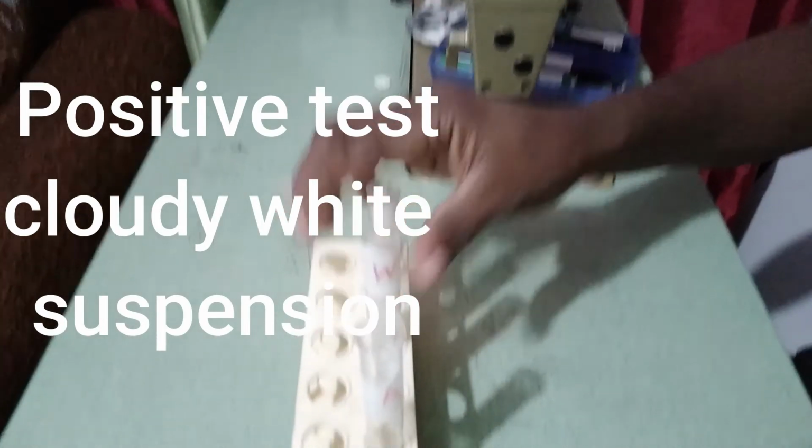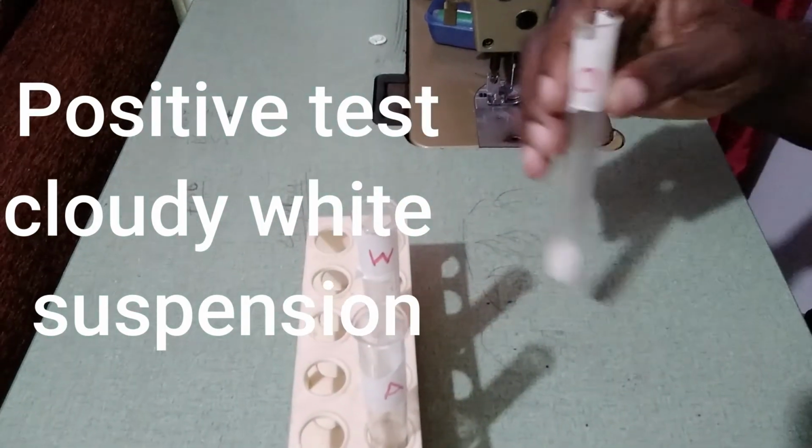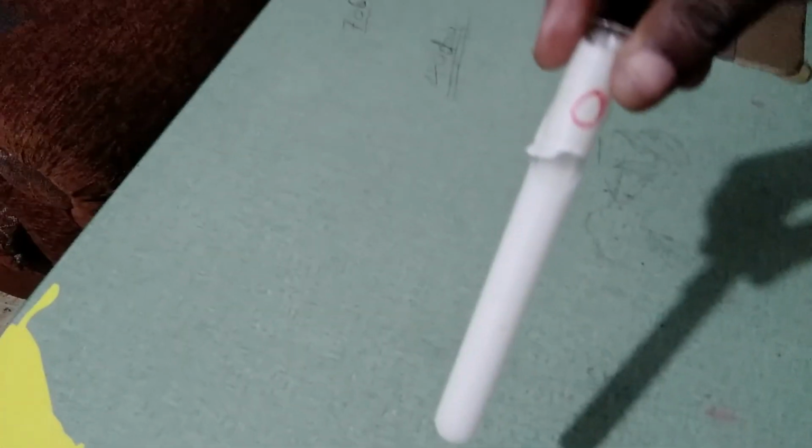So we'll do it again to show you what the positive test would have looked like. So we're going to be using the same volume for both ethanol or alcohol, whichever, and oil, pretty much the same. This is what it looks like when we would have done it a second time.